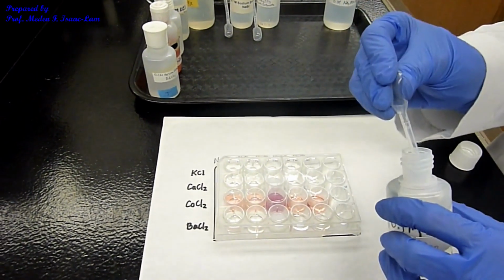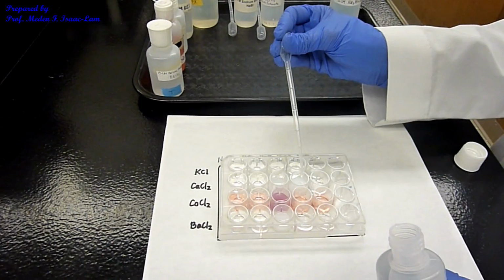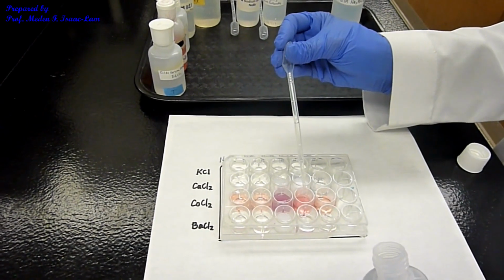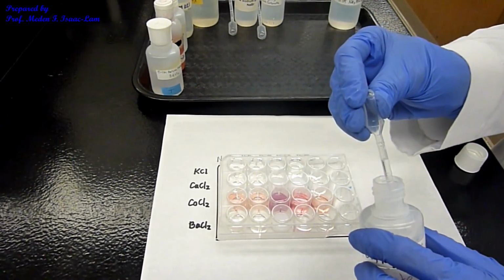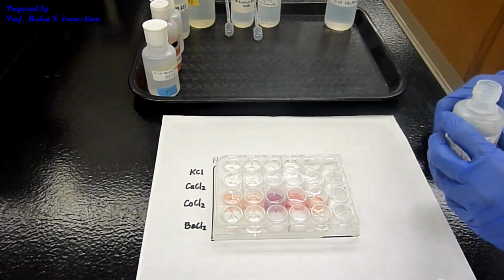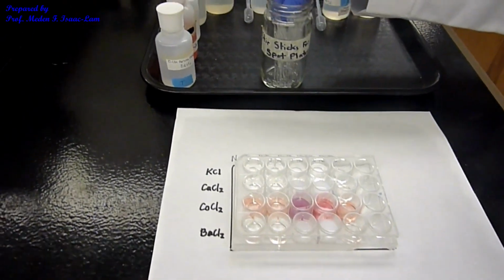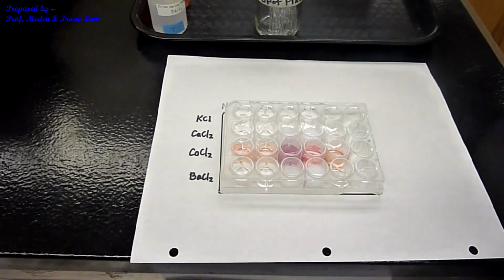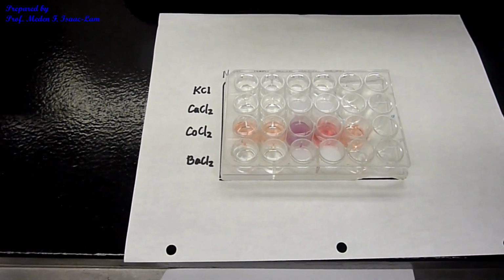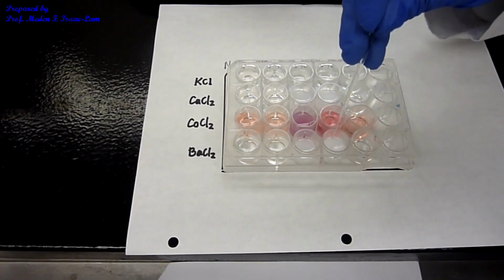First one. Second one. Third. Fourth. Okay? So again, stir it. Stir. Stir. Stir. And then stir it. Okay?